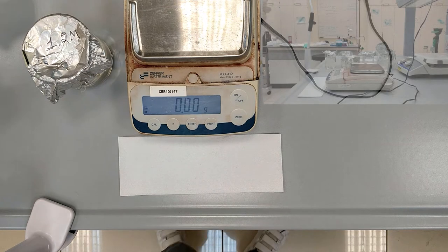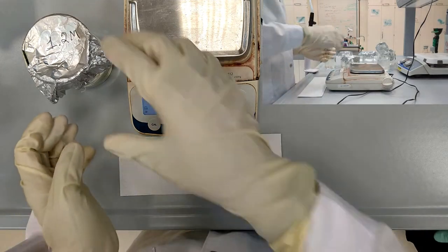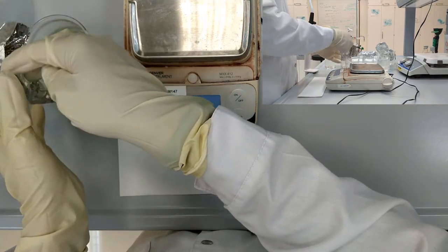Now the 45 minutes have passed and we are going to weigh the dialysis tubes. We start with the distilled water inside.